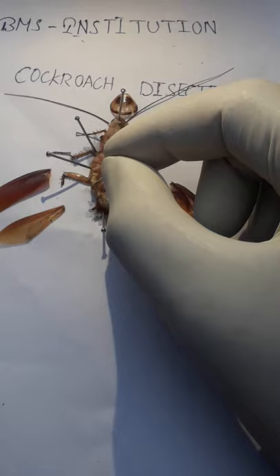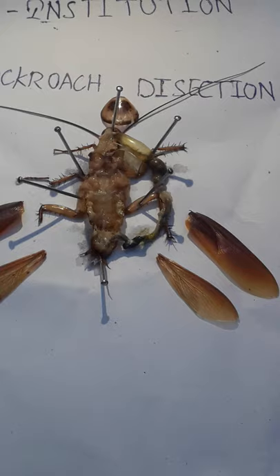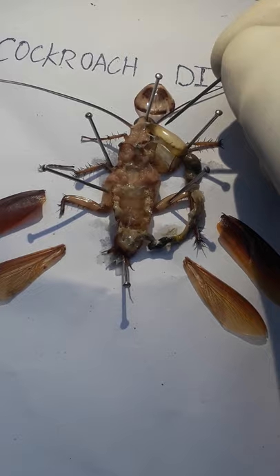Come to the topic — you can see this is a salivary gland. A pair of salivary glands is located in the cockroach, Periplaneta americana. After the salivary gland, there is a continuation into the oesophagus — this is the oesophagus, which I am showing you here.